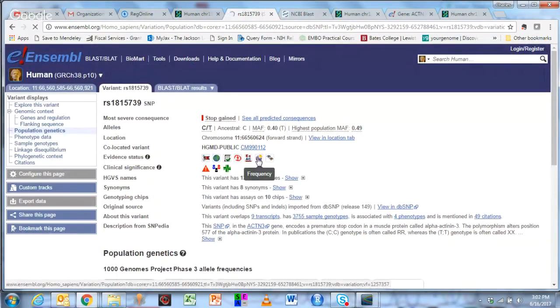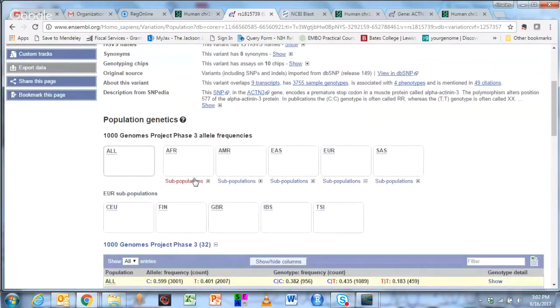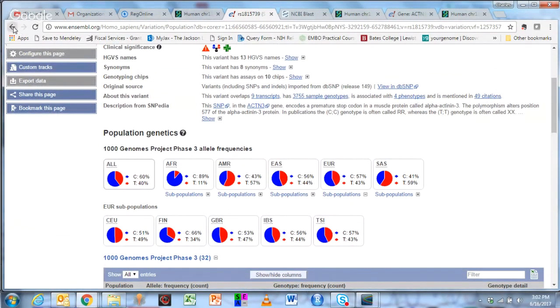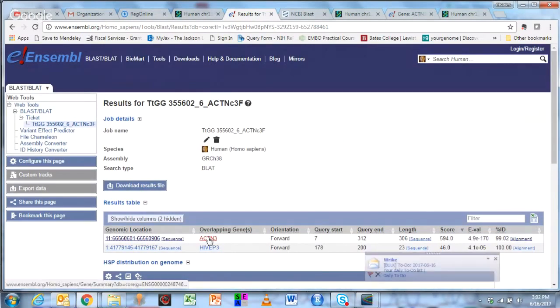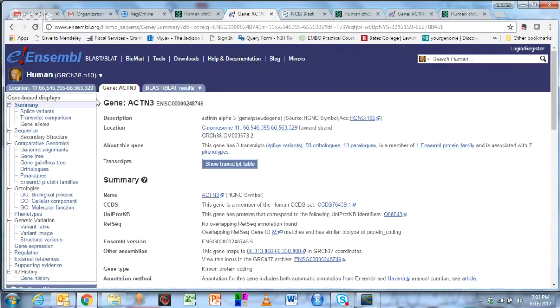You can look at frequency in different populations. It's loading down here. And these are subpopulations, all humans, Africans, American subpopulations. So Finnish is different than British versus Iberian and Spain versus Italian and so on. Okay, let's go back. I think the other great value of Ensembl is its ability to look at gene trees. So I'm going to go to the gene now. And the gene, you have to be in the gene tab, not in the results or the location tab, and you can go to the gene tree.